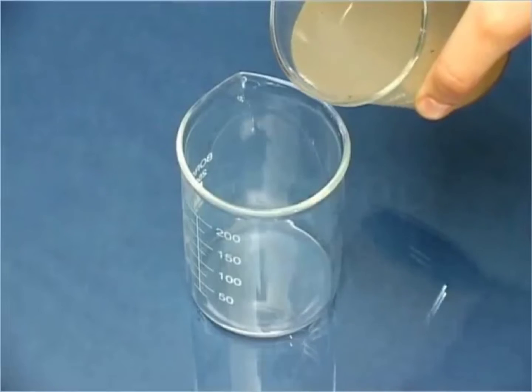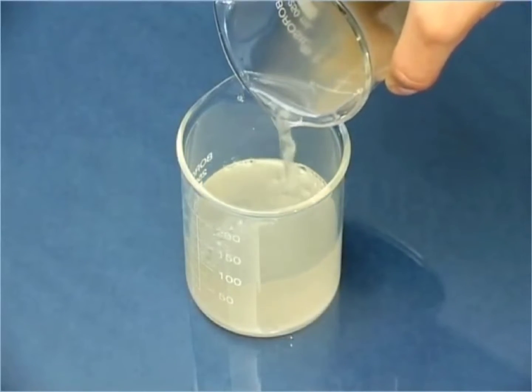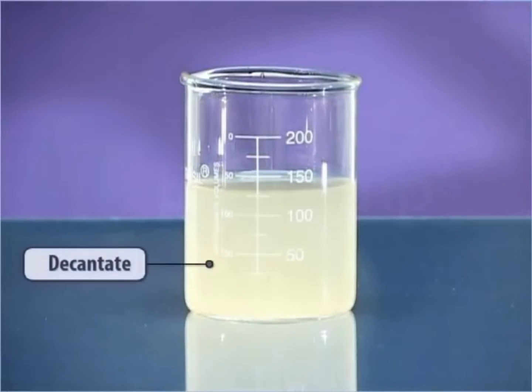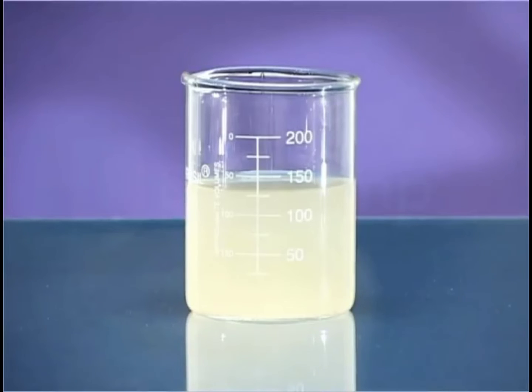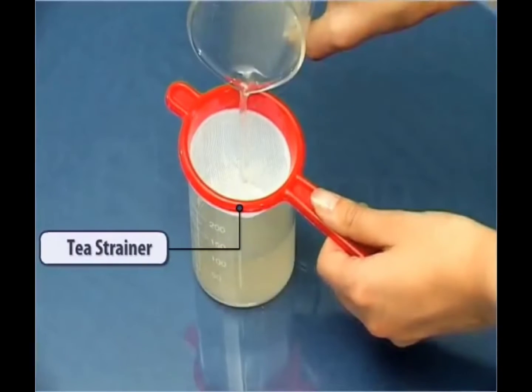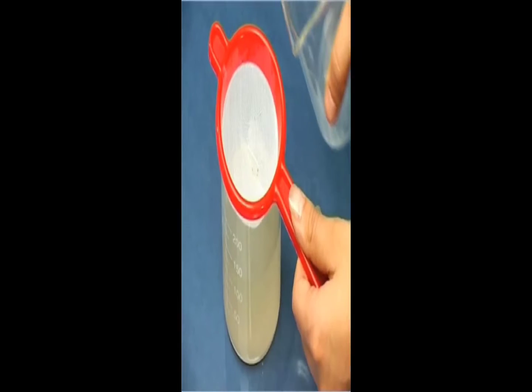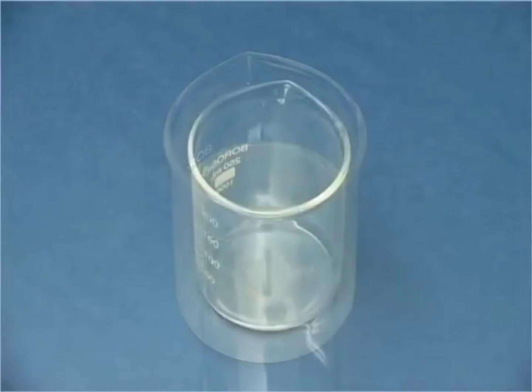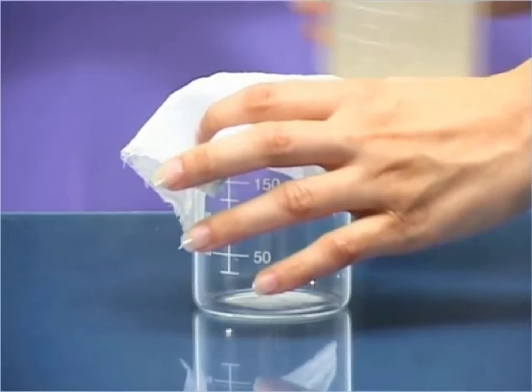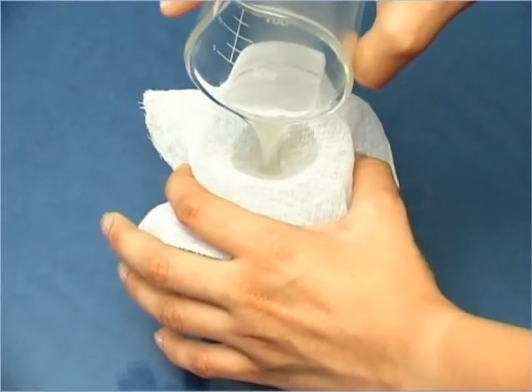Next, transfer the water at the top, leaving the settled mud, by tilting the beaker into another beaker. The water thus obtained is called decantate. Next, pour the decantate through the strainer, and this is called filtering. See the water obtained through the fine cloth: some mud is deposited on the cloth, but the water obtained from filtration still contains mud.